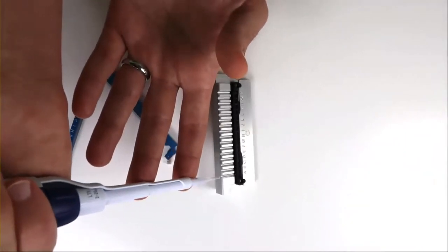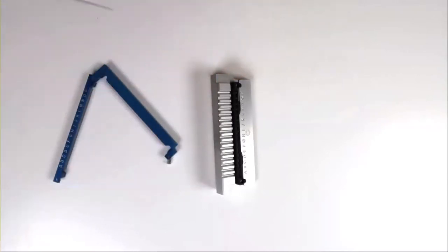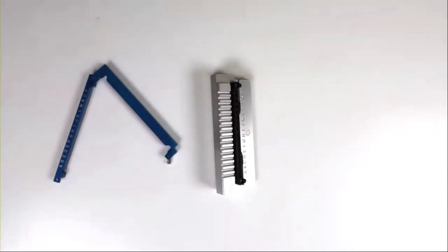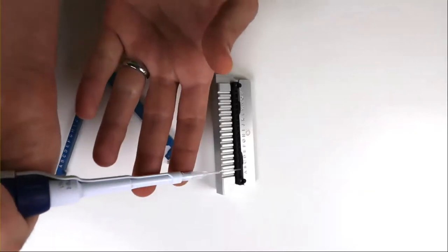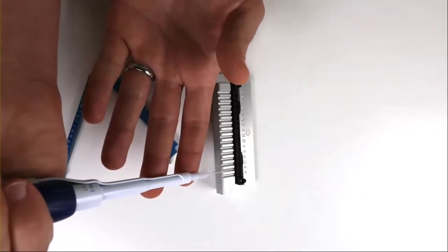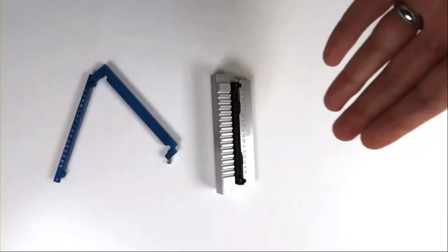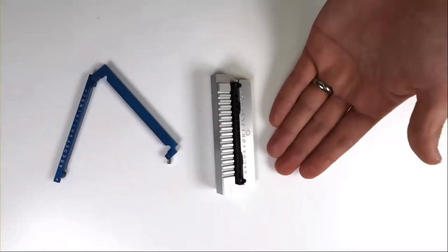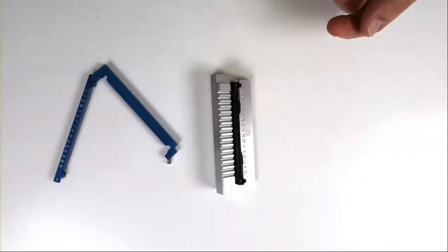The process is easy. I simply insert the pipette tip into the Uni, eject my 8.8 microliters, and that's it — one sample ready to go. Because the sample volume is so small, it is held in place by the capillary forces involved in that tiny capillary.